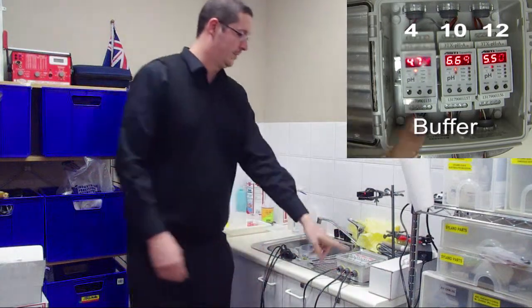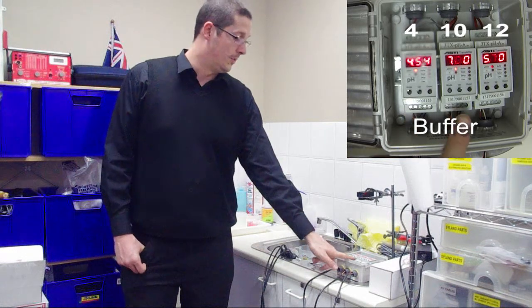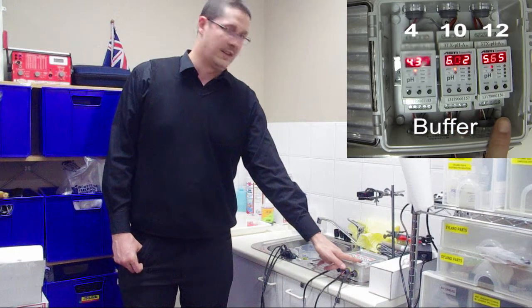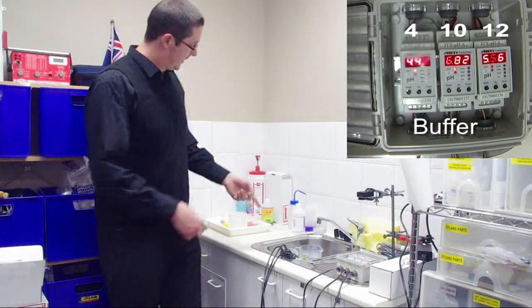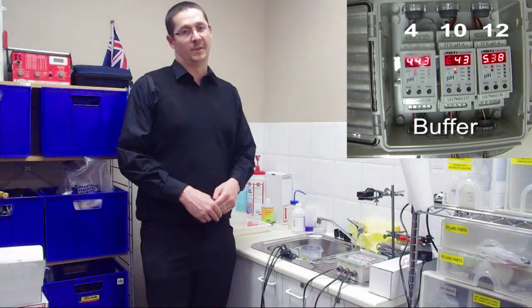This transmitter here on the left has been calibrated to pH 4 buffer. The one in the middle has been calibrated to pH 10 buffer. The one on the end has been calibrated to pH 12 buffer. Now in the sink here, I've got a couple of different solutions. One of them is quite acidic, one of them is quite basic.